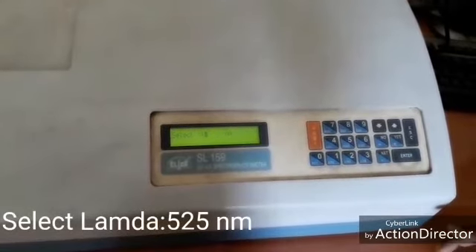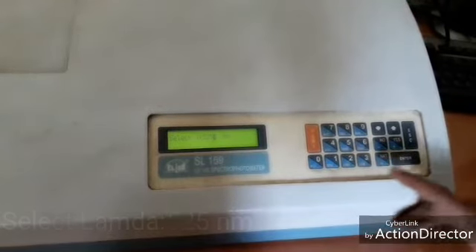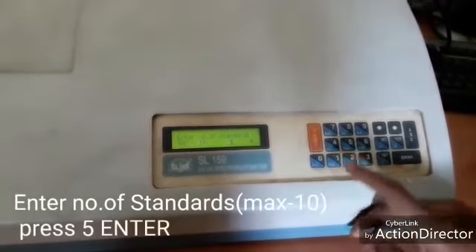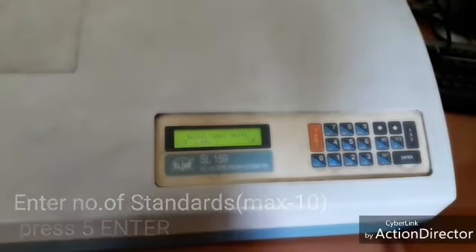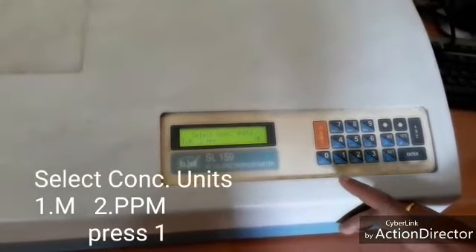Enter the lambda max. Lambda max 525. Enter 525. Then enter. Number of standards 5. Then enter.